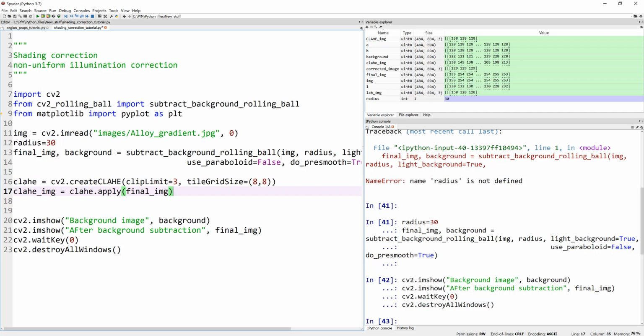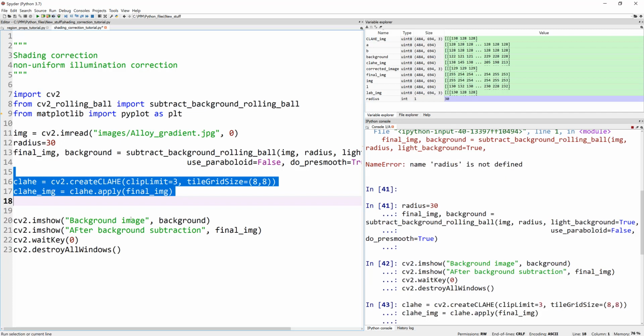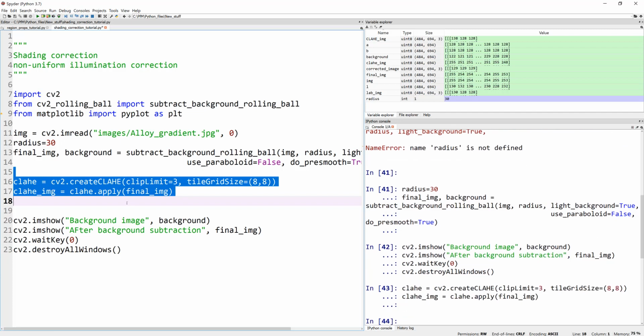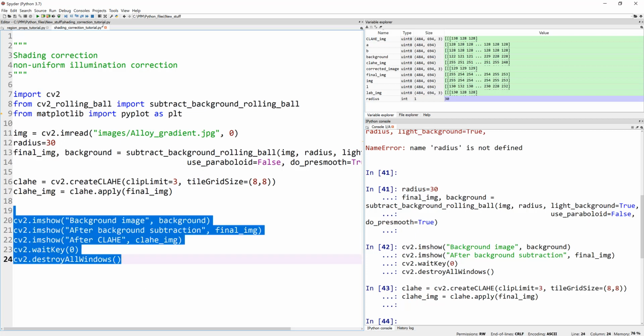Again, I'm not separating the L, A, B channels and everything, just because this is a gray level image, I'm applying it right on this image. So let's run these two lines. All I'm trying to do is perform this CLAHE histogram equalization on the previous image to see if it improves our result, and I hope it should. Let's add that for our visualization, and run this one more time.